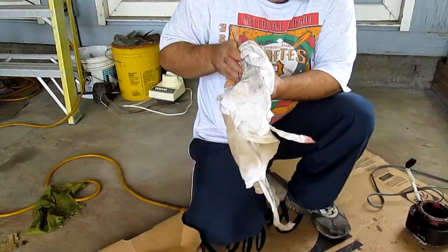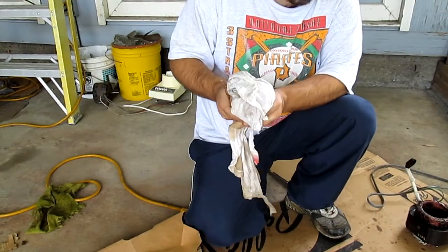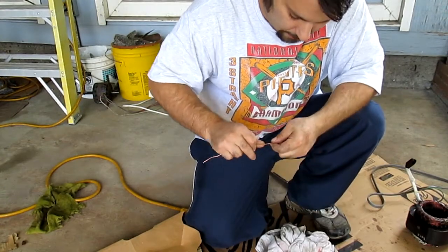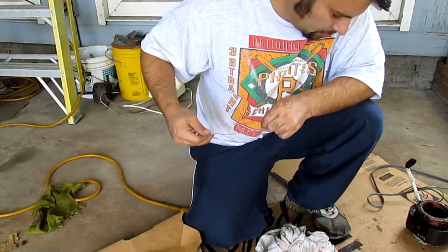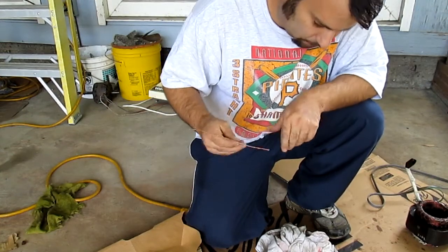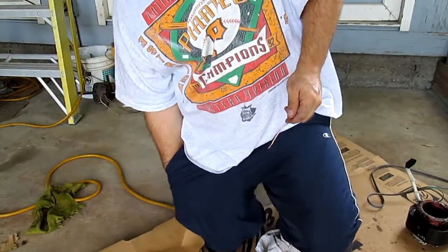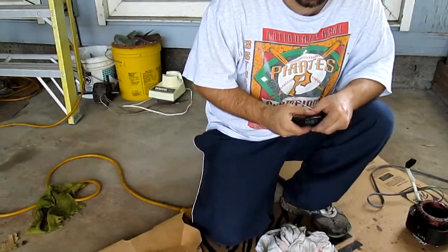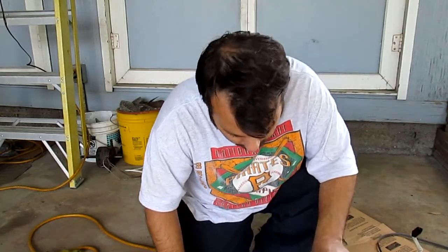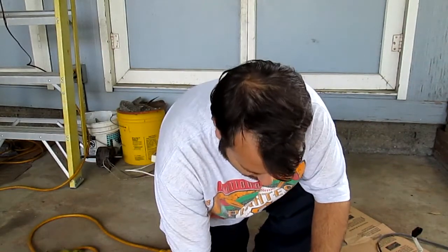One of the people I was talking to about this kind of test was Ed Systems OC50, because he was kind of wondering the same thing, and I went ahead and looked up some additional information on it. Basically — and I could be wrong — you get a piece of clean, solid copper wire. And I got the mineral oil here.